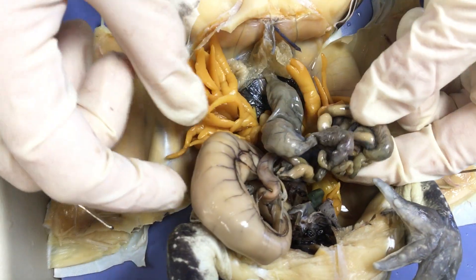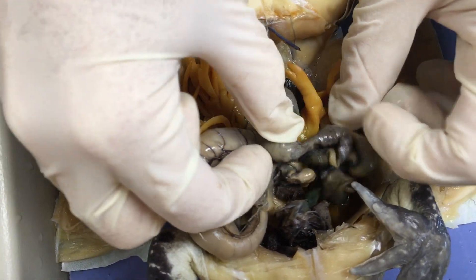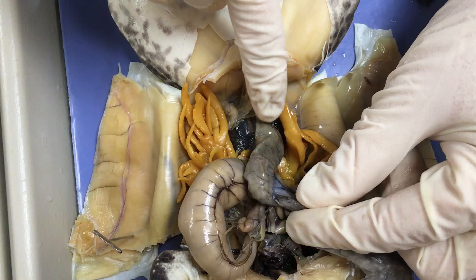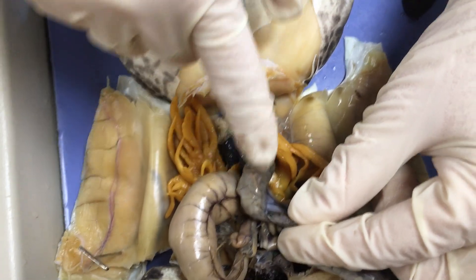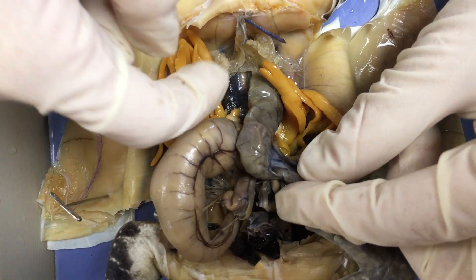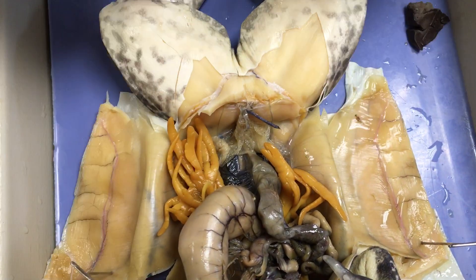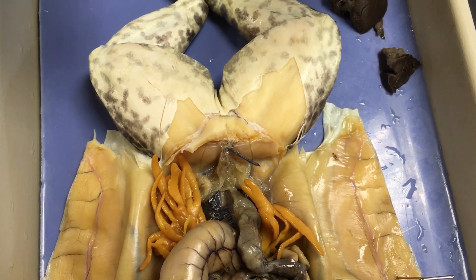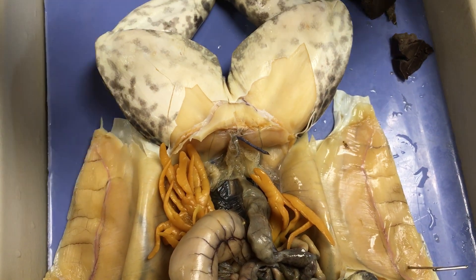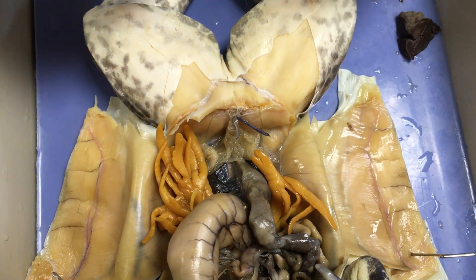As you can see in the torso of this frog, there's small intestine all coiled up in here. Eventually, if you trace it all the way down, it will turn into the large intestine. It's named the large intestine because of the wider diameter. This structure runs along the back of the frog and is the large intestine. It connects to the cloaca, which we identified on the external structures, right in between the frog's legs. This is the only exit that frogs have — whether it is urine, solid waste, or reproductive products, they all come out the cloaca.